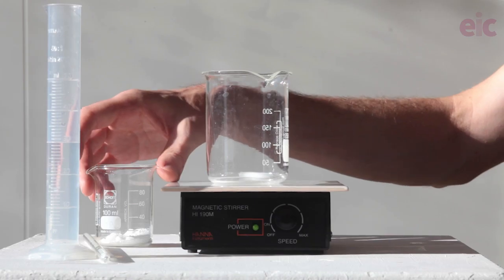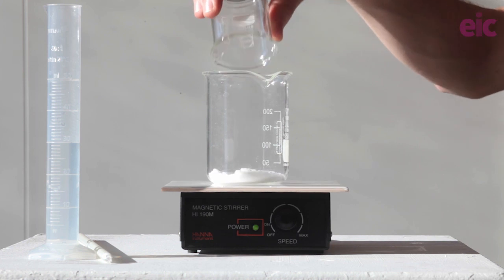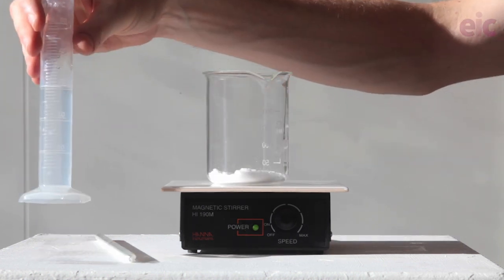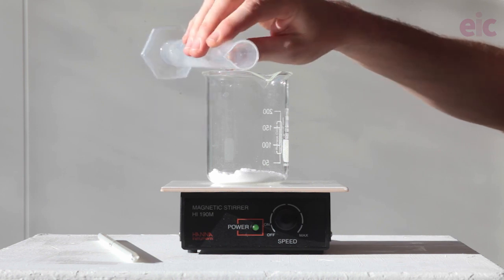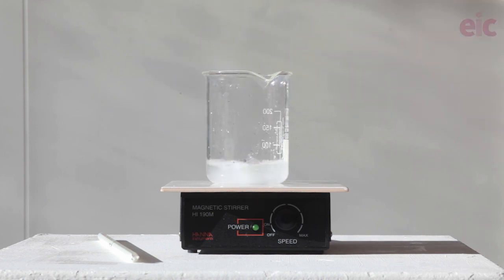We're going to be using a one molar solution of potassium sodium tartrate. You can make up a stock solution, but just in case you wanted to make just enough for one demonstration, I'll show you how to do that too. I've got 8.47 grams of the tetrahydrate salt here, and I'm going to dissolve that in 30 ml of water to make up a one molar solution.